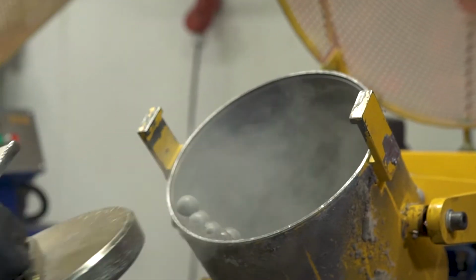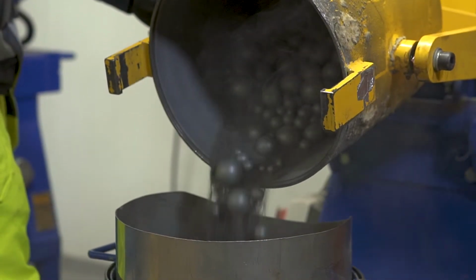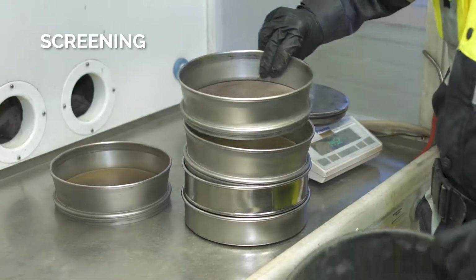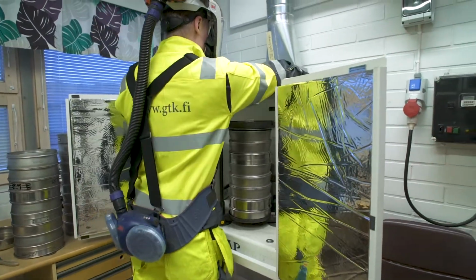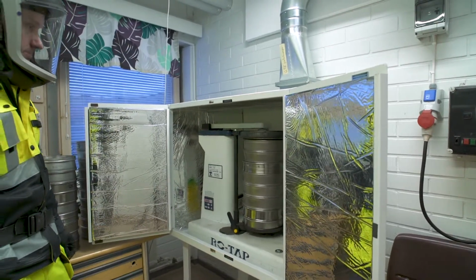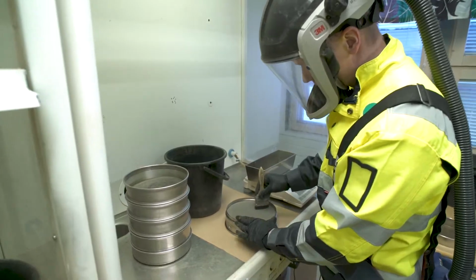When this is achieved, it is possible to calculate the work index for the ore sample. After each period, the sample is screened on the selected closing screen size, and the undersized material is replaced by fresh, unsegregated feed to bring the total initial weight back.